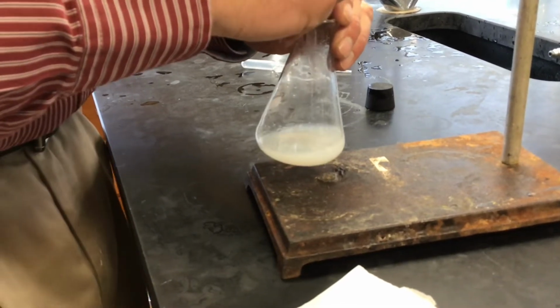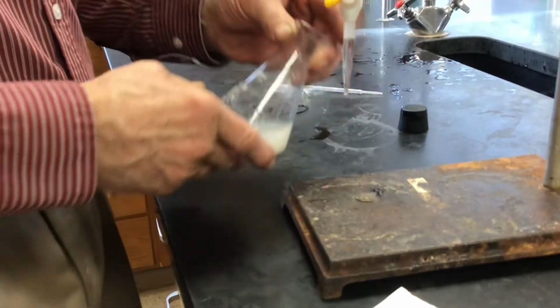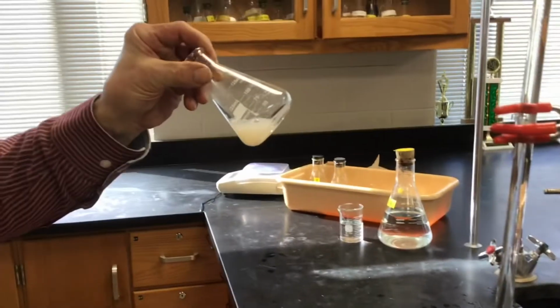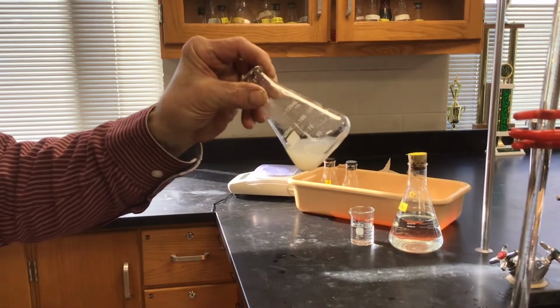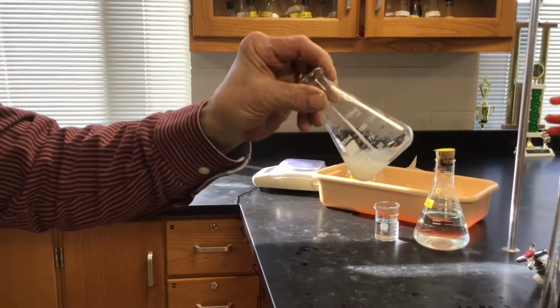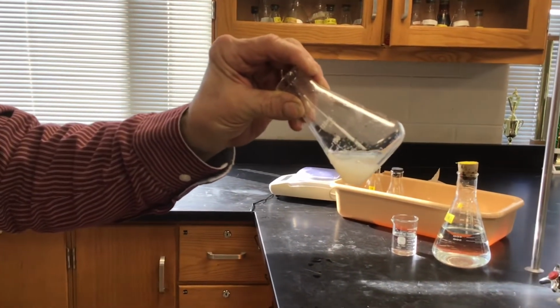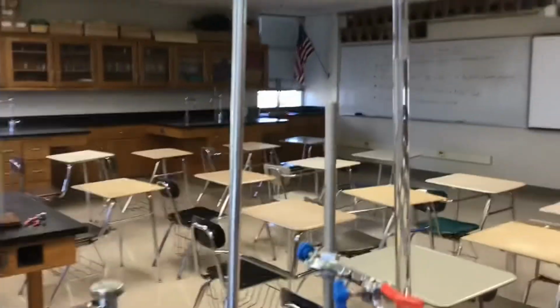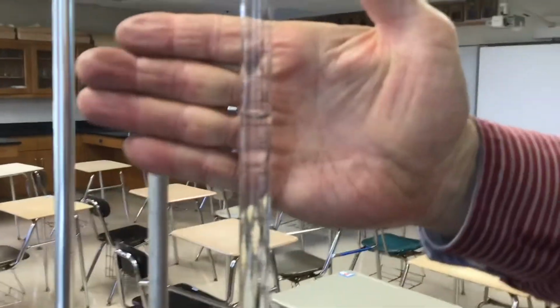It started looking clumpy. I think you got the brown. For sure now it looks brown. Now, I don't know if I went past. This is a case where it's good to run another trial, I think. We may just run another trial and throw the first one out. I was going by our first trial, and that's okay. I probably went a little longer than I should have.